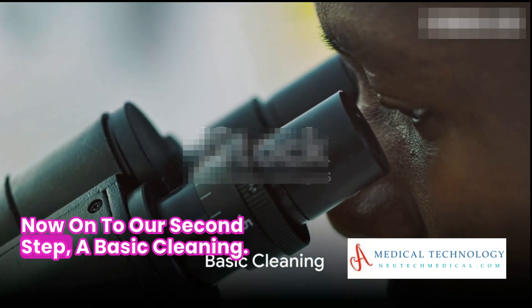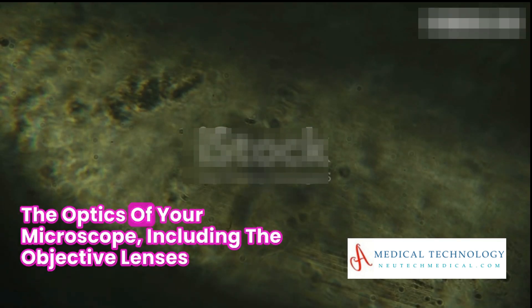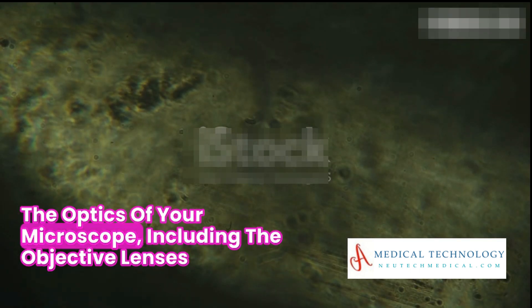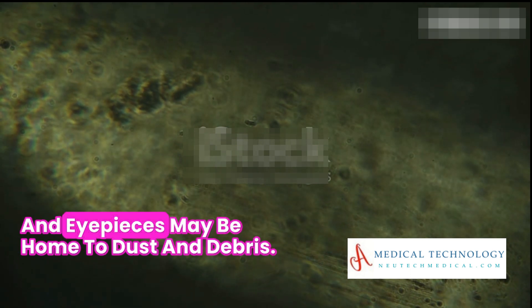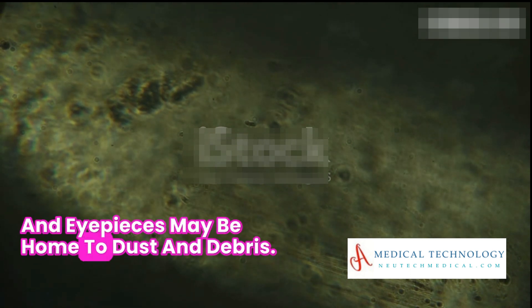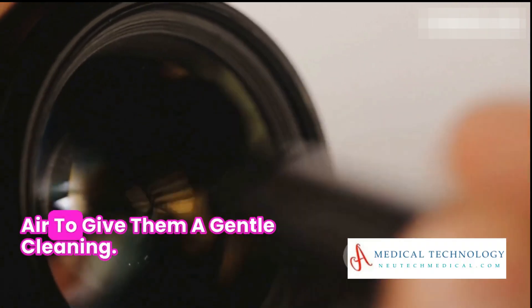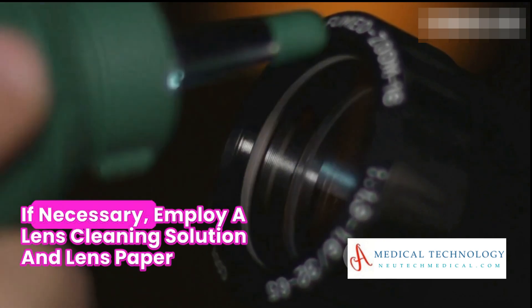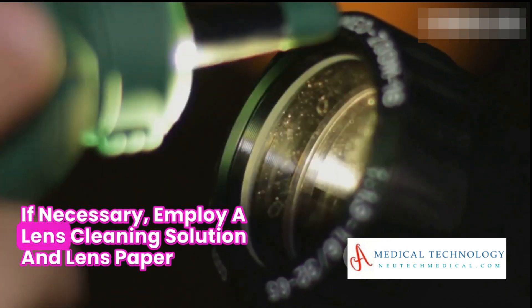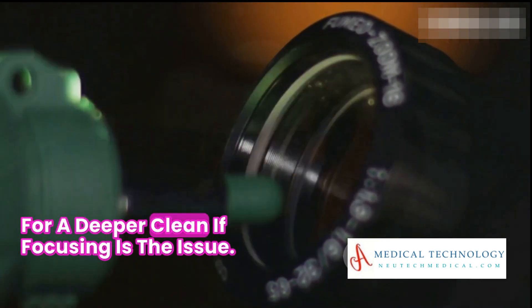Now, on to our second step: a basic cleaning. The optics of your microscope, including the objective lenses and eyepieces, may be home to dust and debris. Use a soft lens brush or compressed air to give them a gentle cleaning. If necessary, employ a lens cleaning solution and lens paper for a deeper clean.